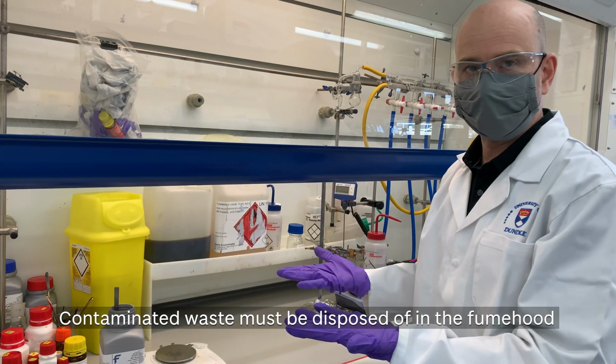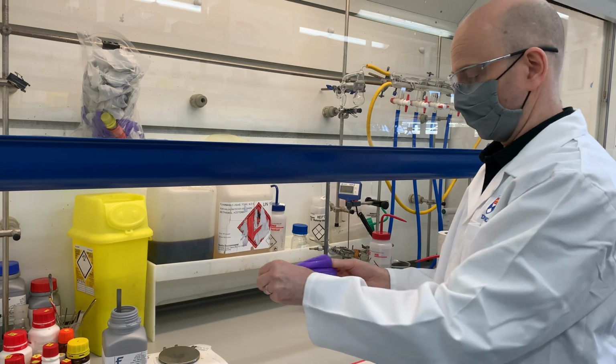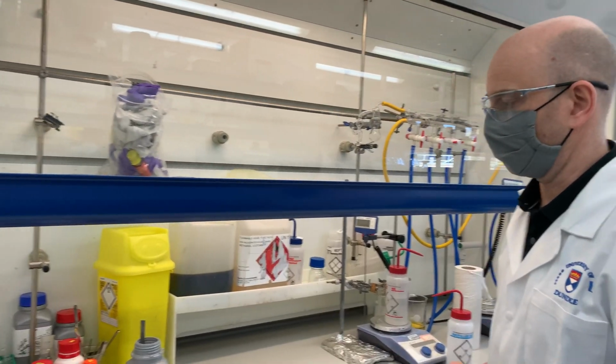And because I've been cleaning, it's usually best practice to remove the gloves that I've used. And the area is now safe.